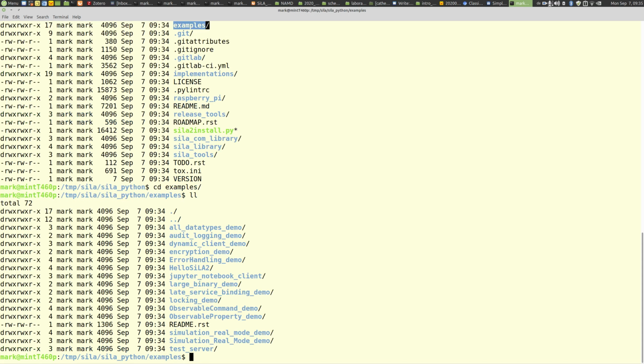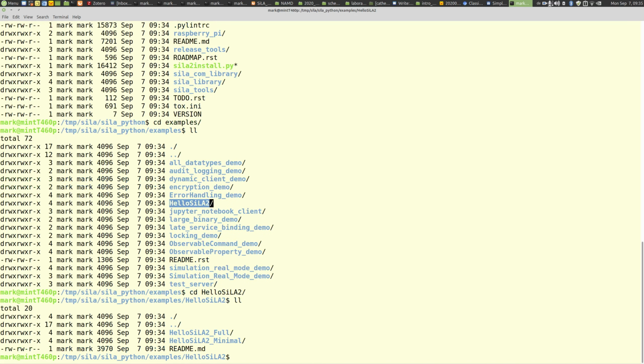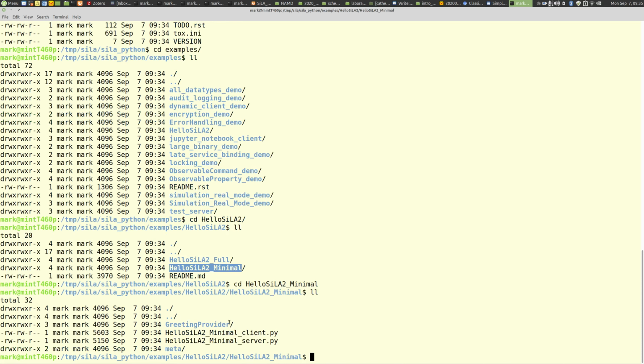Examples. Let's see how it looks. So here's the Hello SiLA example in it. Hello SiLA example, and here we have two examples in this directory. One a little bit more elaborate, but we want the minimum one, so we select this one. And in this directory you find everything you need to run these examples. So here's the Hello SiLA server and client, and in here is the greeting feature that is provided. So what's happening is that the client sends a string to the server. The server simply replies with a greeting of this string, and that's it.